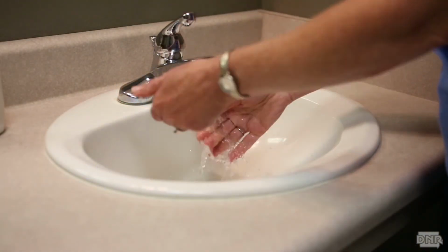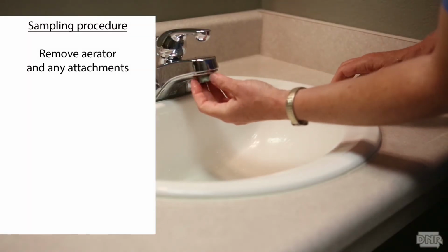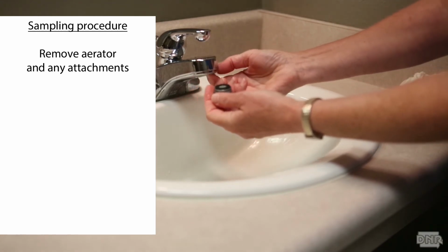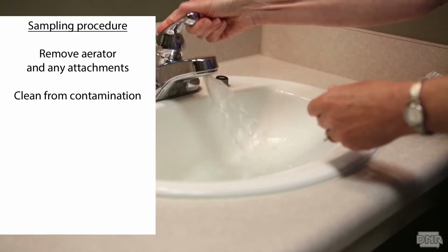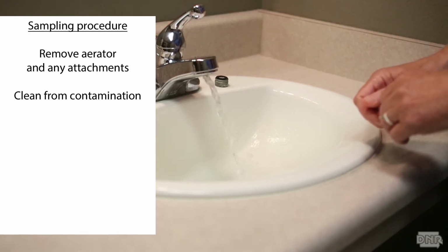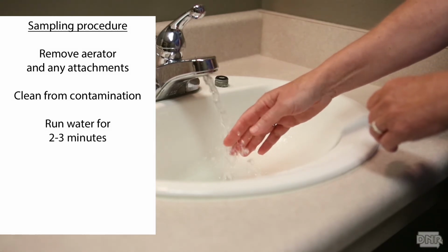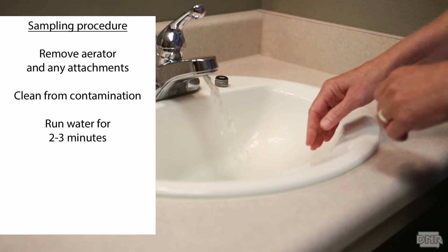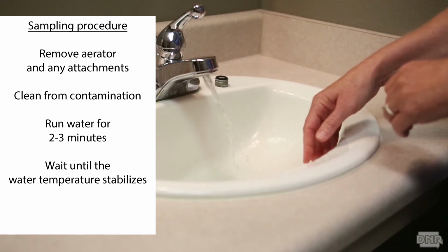Before you start, always be sure your hands are clean. You may wear latex gloves when sampling if you'd like. Collect the sample using the following procedure. Remove any hose attachments, aerator, or screen on the end of the faucet or the tap. Ensure the faucet or tap itself is clean from contamination. Open the cold water tap to obtain a smooth flowing stream at a moderate pressure. Allow the water to run to waste for 2-3 minutes or for a sufficient time to clear the service line. This can be determined by waiting until the water temperature stabilizes. This is a good time to complete the sampling form.